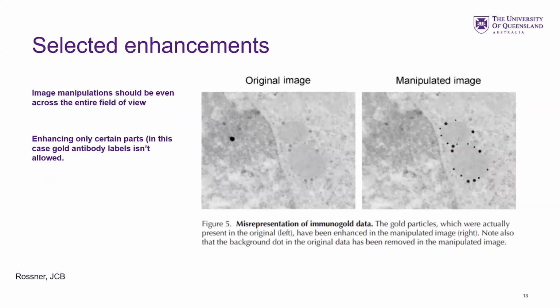You certainly also can't artificially enhance certain regions of the image. So here we've had some gold labeled EM, and the gold particles here have been artificially darkened to make it more obvious. While that might seem kind of innocent, it's not allowed. You can't just increase certain parts.